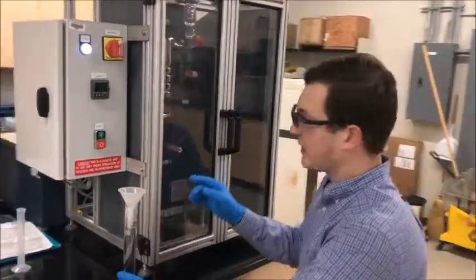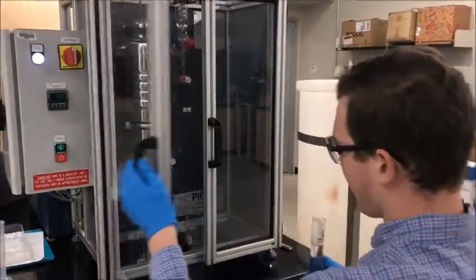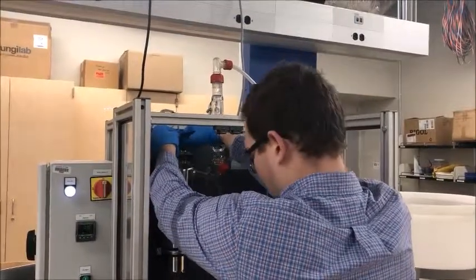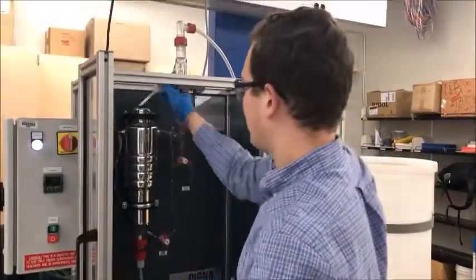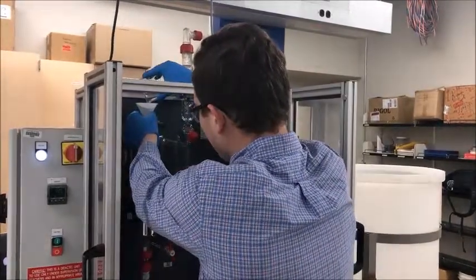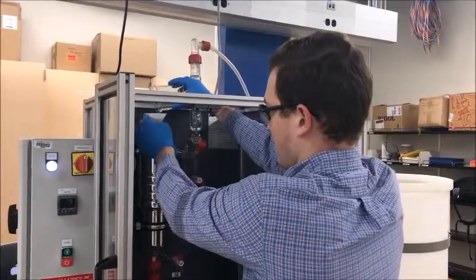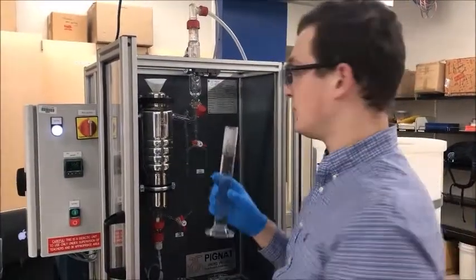Once our system has stopped bubbling, and we can see it through the slit on the glass in the front, we can then open the apparatus back up and unscrew the thermocouple at the top. Once this is unscrewed, we use a funnel to recycle our previous streams and to add the water to continue diluting our solutions.